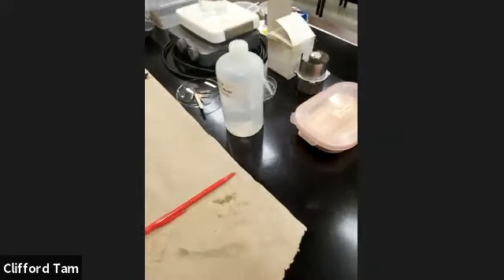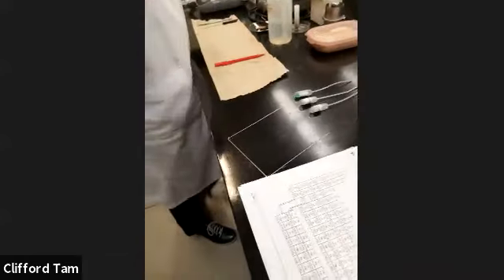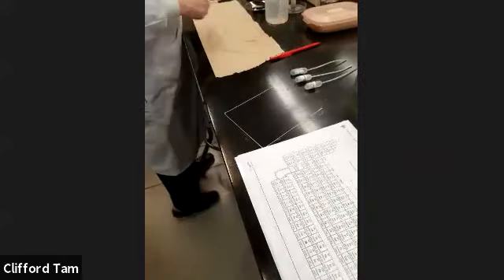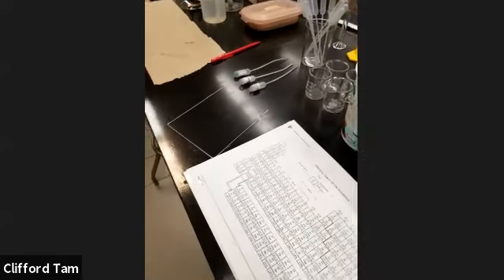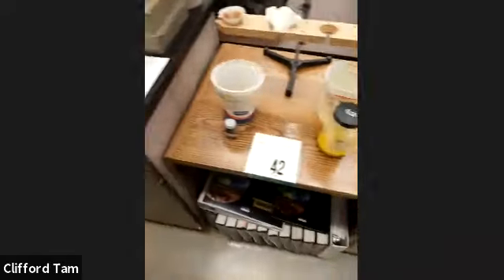Okay, so thank you, Xantha, for that part. We are now going to move on to our second demonstration, which has to do with, I believe, concentration. Yes, it does. So for this one, I'm going to need you to tell me the amounts and which one I'm doing first. Okay. Yep. So if you can pull that up and bring it around here so I can see.